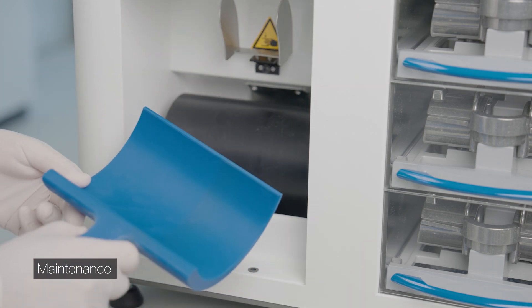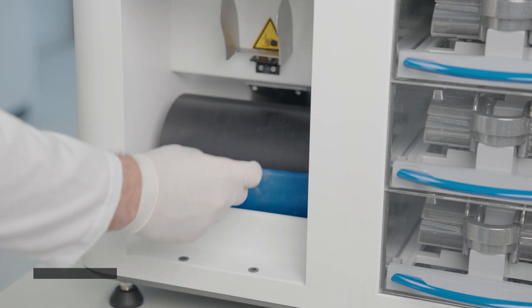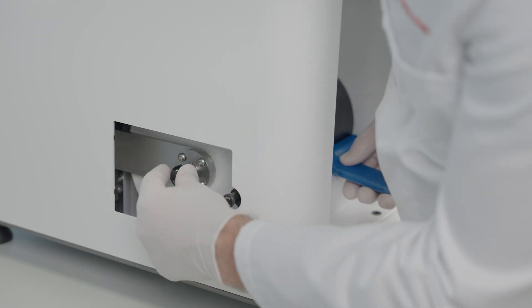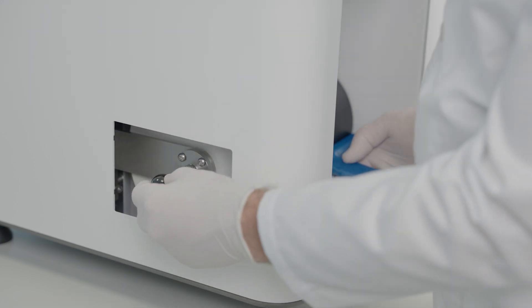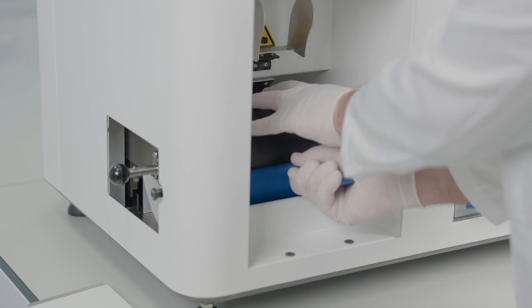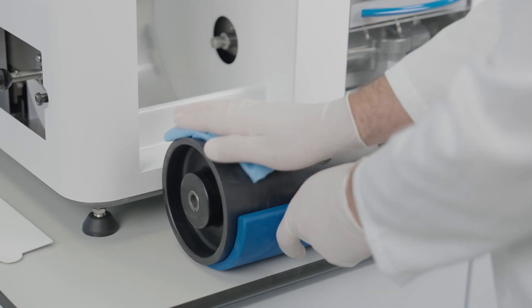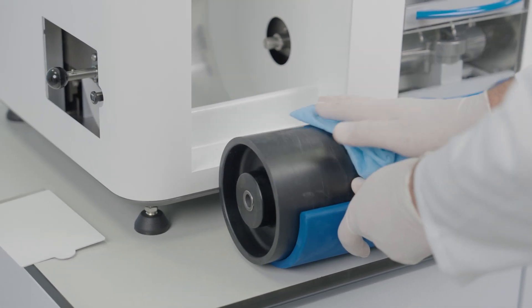Release and remove the maintenance flap. Turn the bayonet lock clockwise to release. Shift the dough roll left and remove. Clean and dry the dough roll and casing.